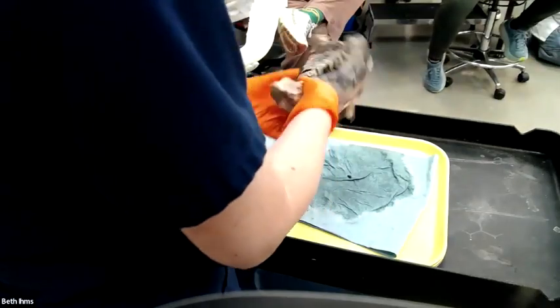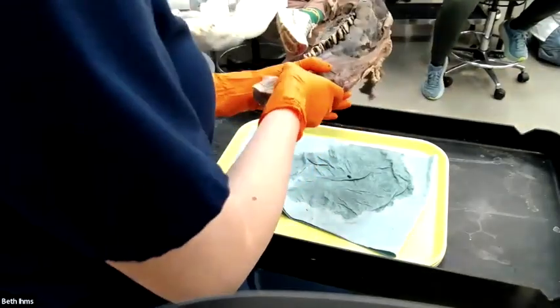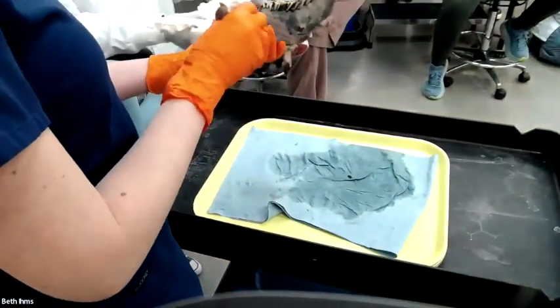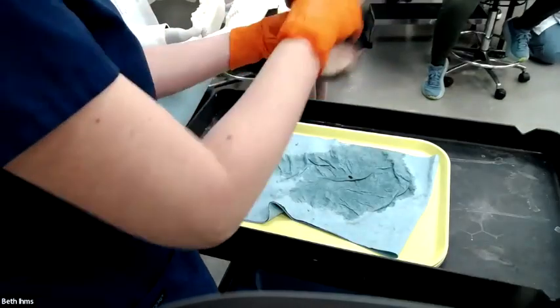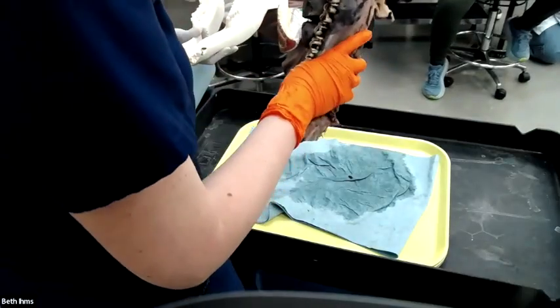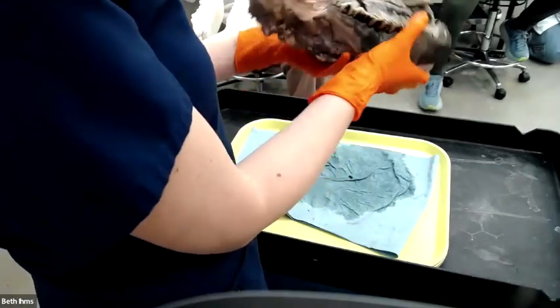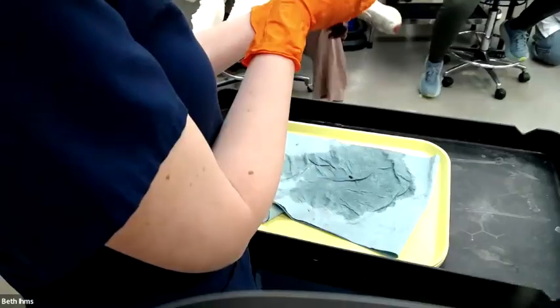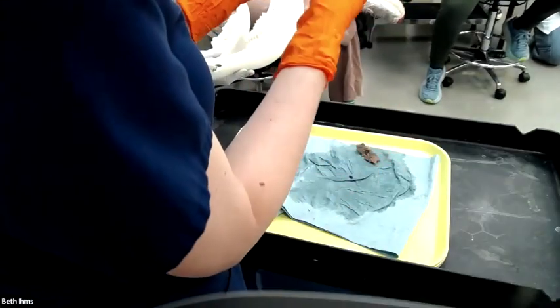Is it focal, multifocal, diffuse? It's multifocal. You could make an argument for regionally extensive because from here out is normal and from here back there's no normal left. But it is multifocal. We have multiple coalescing nodules. I usually consider that multifocal. It's massively enlarged.